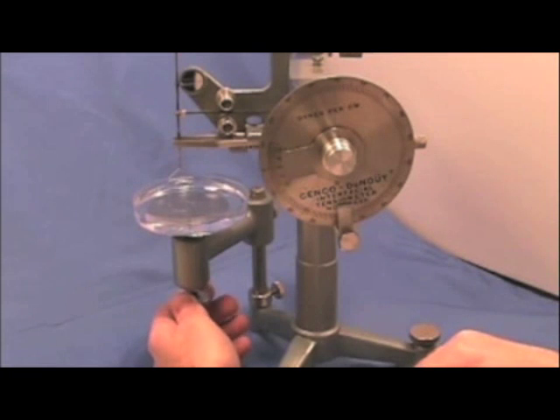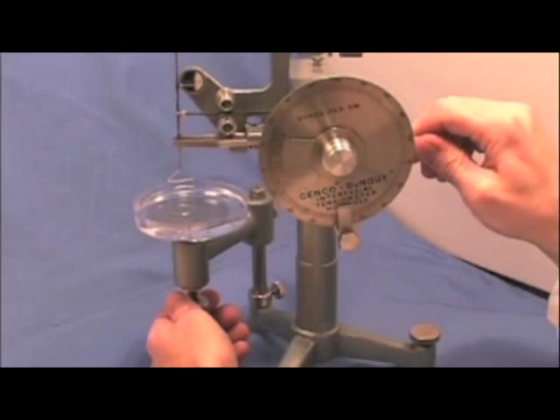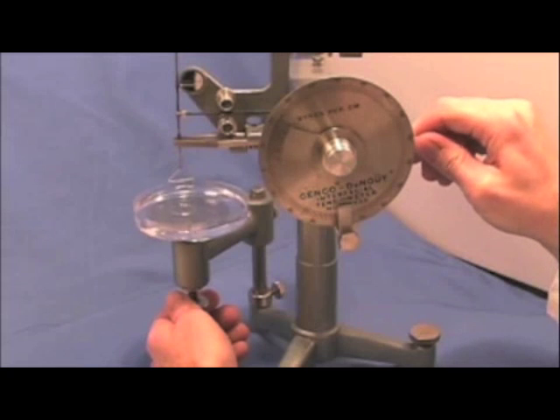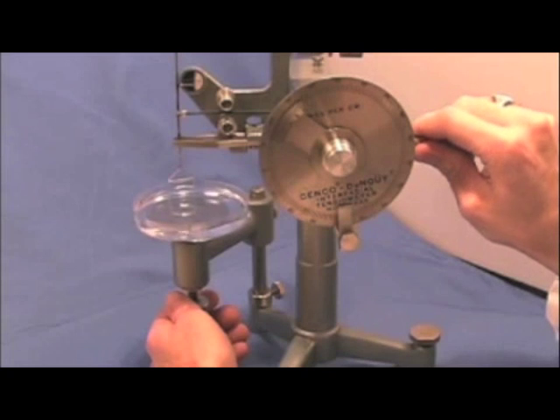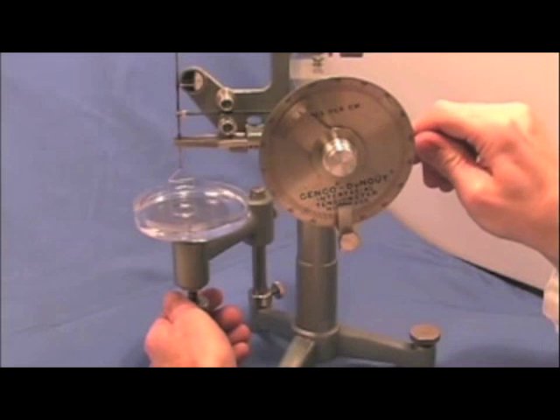Until the point where I see it's starting to deflect the needle because of the strain. It's starting to move now. With my right hand that'll bring it back and measure the actual force of the strain. So we're level again, drop the table a little bit more, compensate and adjust with my right hand.